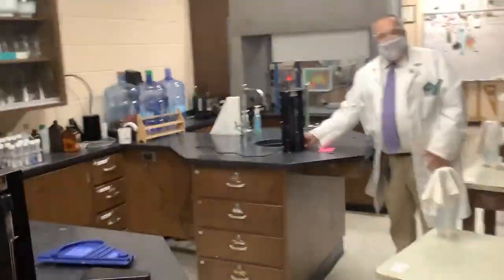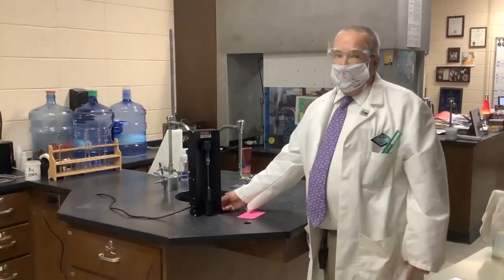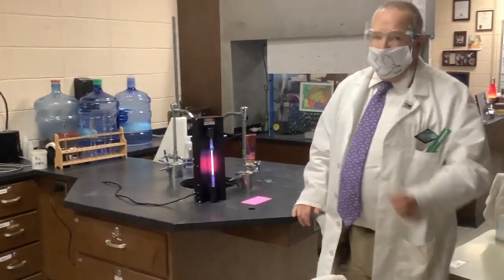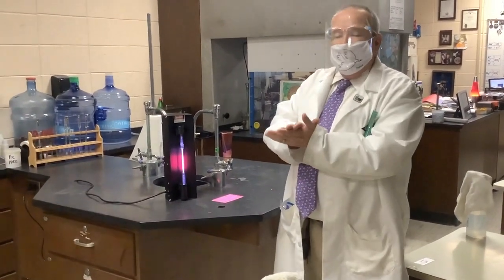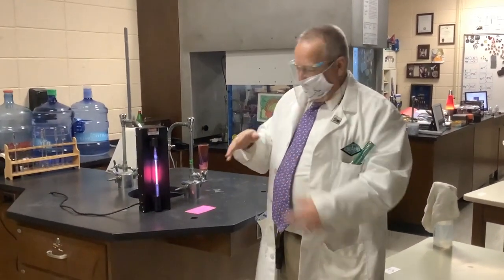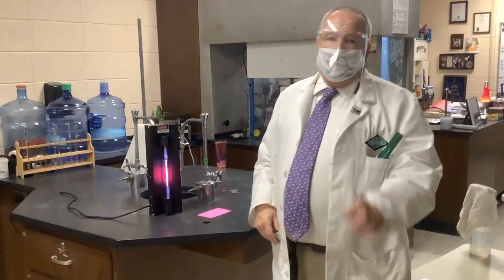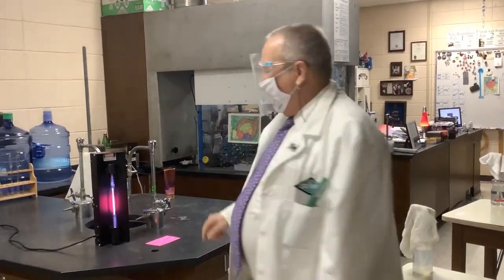is hydrogen. One of the simplest ones, and the original one that Niels Bohr used, using equipment very similar to this, to deduce the line spectrum for hydrogen. Because remember, hydrogen is element number 1, 1 proton, 1 electron. But that 1 electron can move into lots of different orbits when it's excited, and it can fall back down to a variety of different orbits and produces some very unique spectral lines. I will post a picture of the spectrum so that you can see what you would have seen had you been in lab and saw the spectrum.